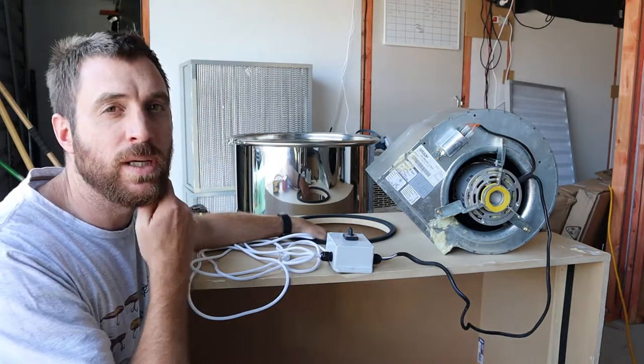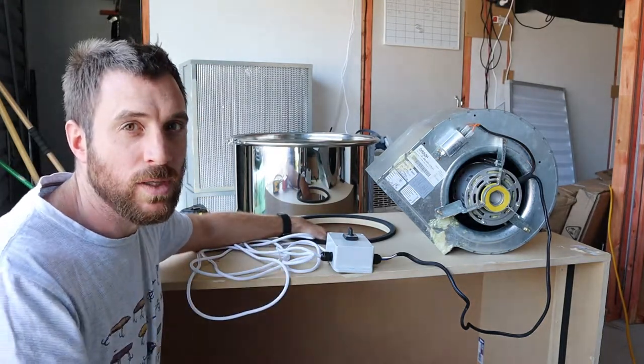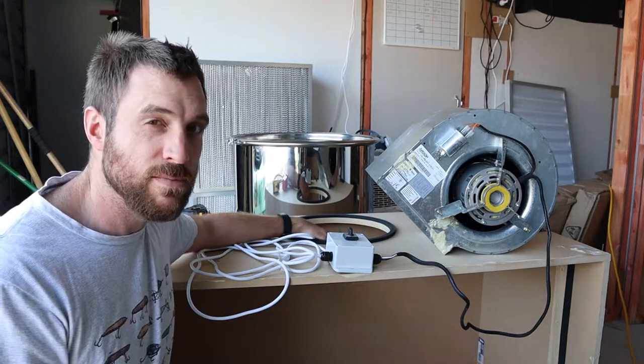There's another video of me making my laminar flow hood. I'm going to be doing the adaptions to it, which I'll put up as well once I finish, but this is just to show you guys the difference in my two fans.